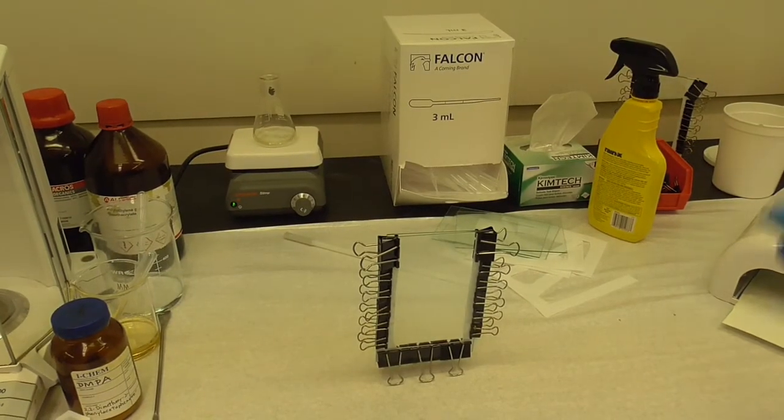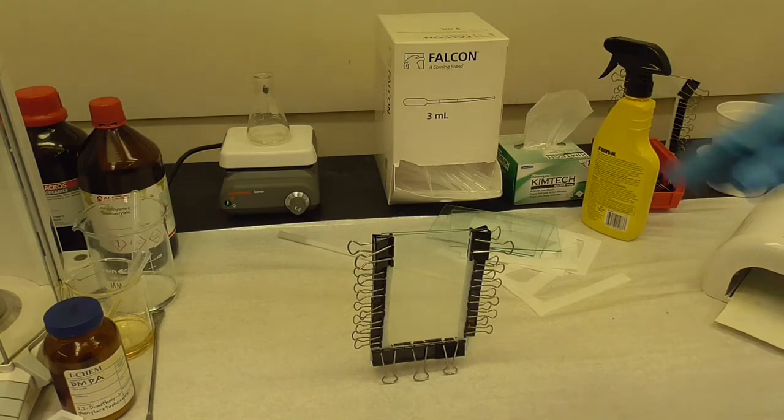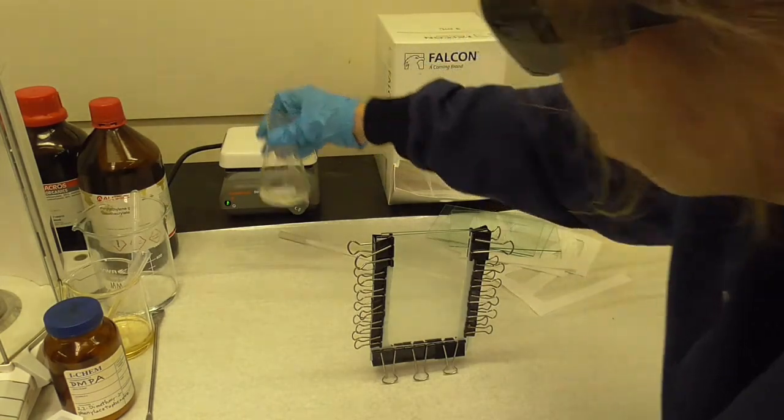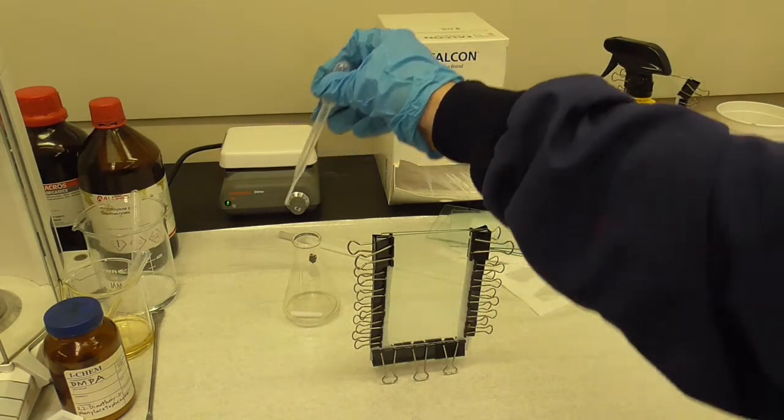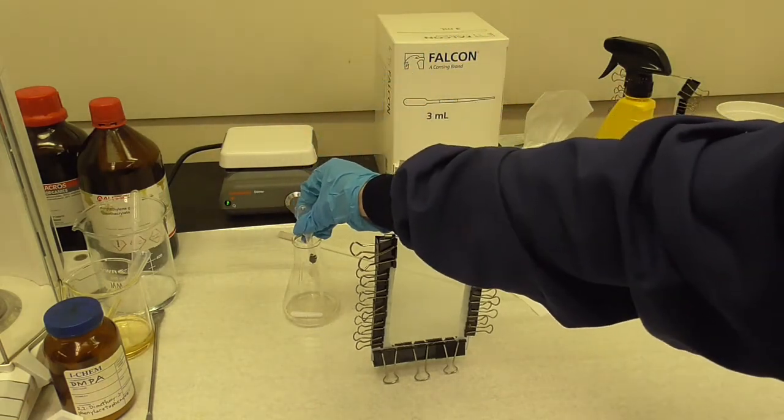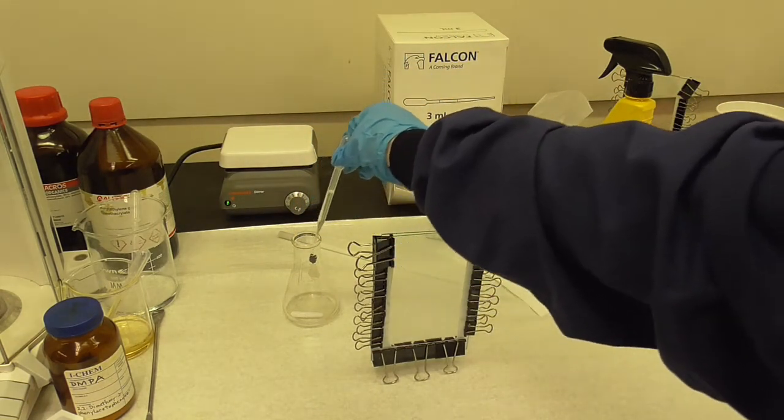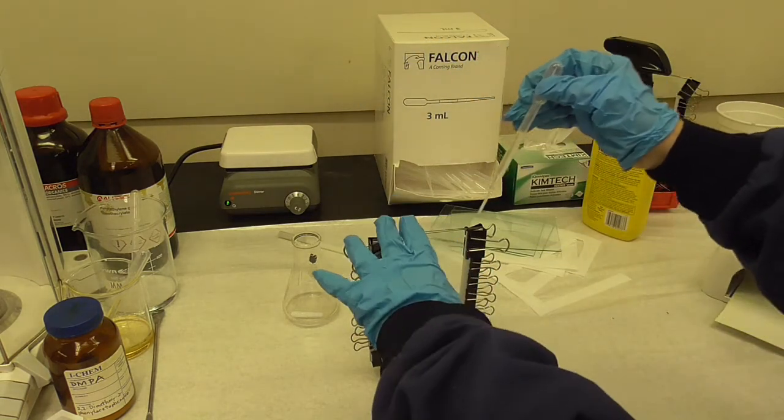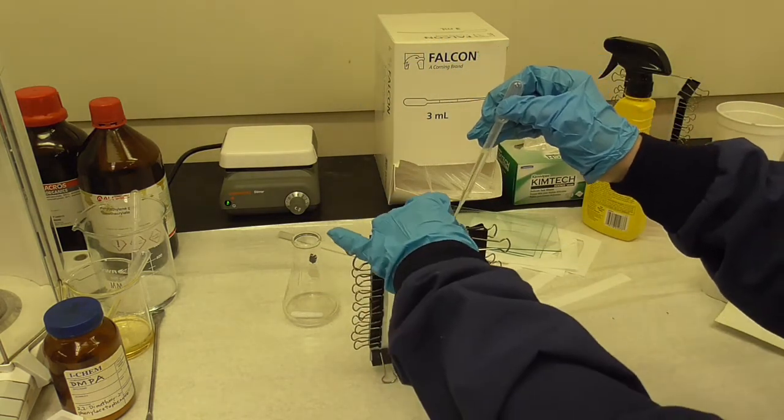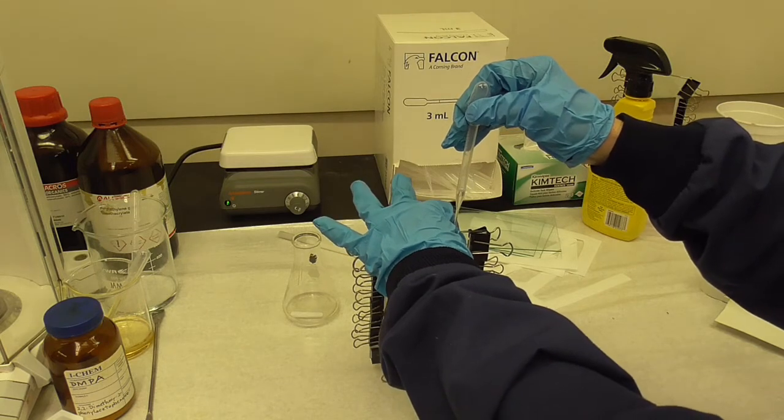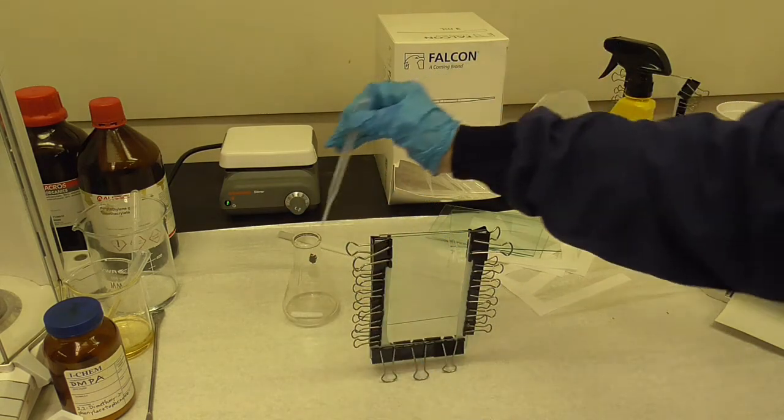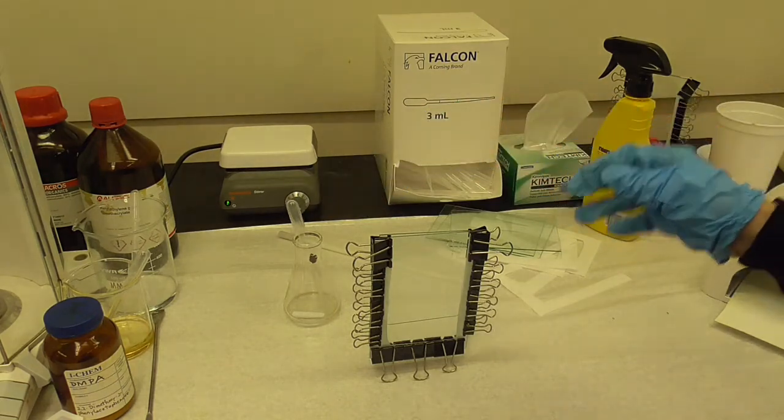In the time it takes to make your mold the solution should be mixed. You'll just get a transfer pipette, fill it with the monomers and then put it over this slit in the glass and it will fill into the glass, mostly because of capillary action.